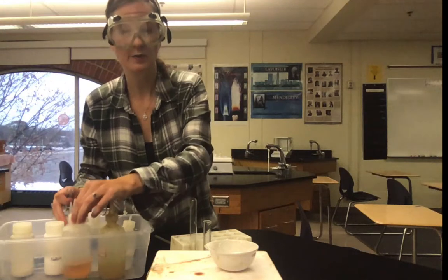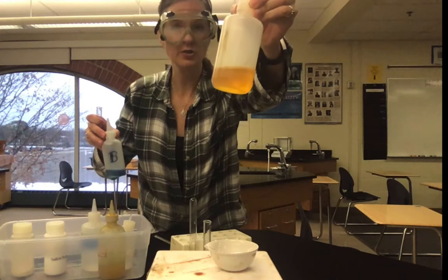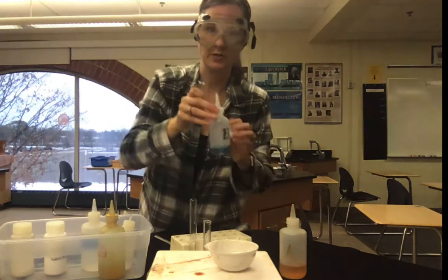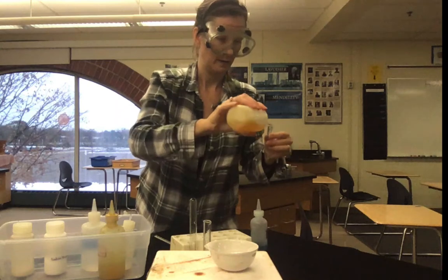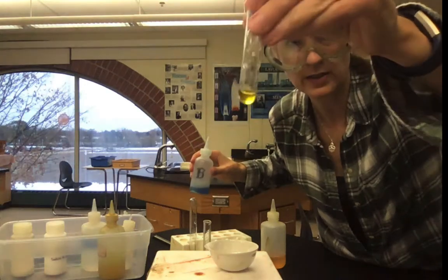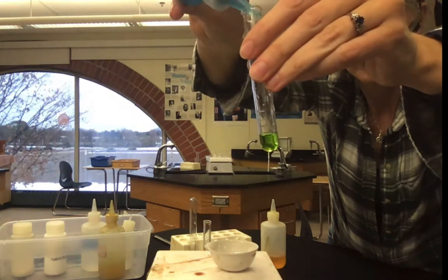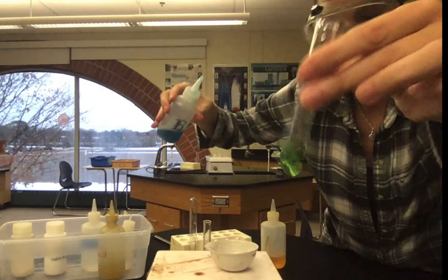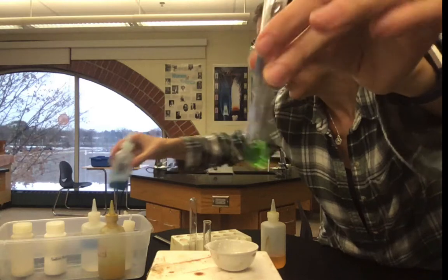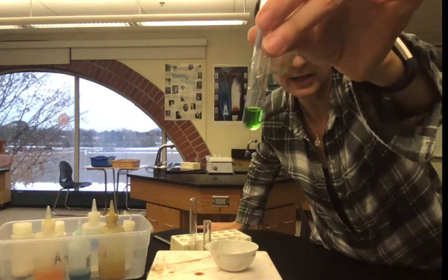The last experiment for this activity is to take solution A, which is this slightly yellowy orangey colored solution, and 5 drops of that mixing with 5 drops of this bluer colored solution. So in the test tube, that's what A looks like. And then when I put 5 drops of B, that's your final result. I would say it's pretty lime green in color, still fully transparent, just like the water was and just like the solutions were, so no thickening of the material.